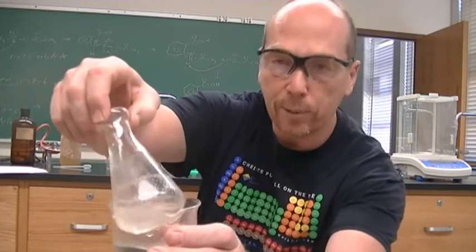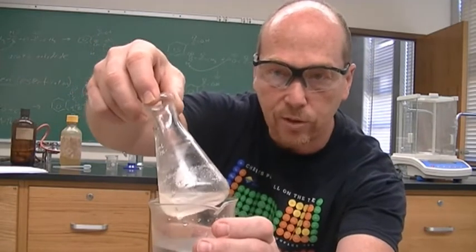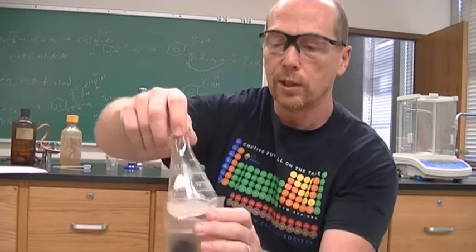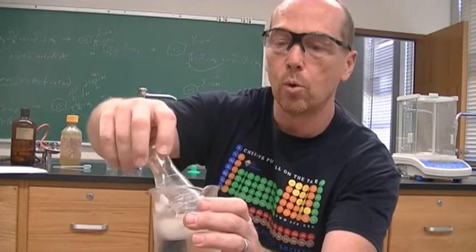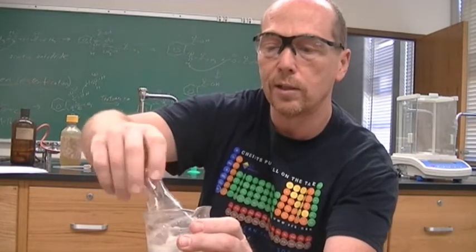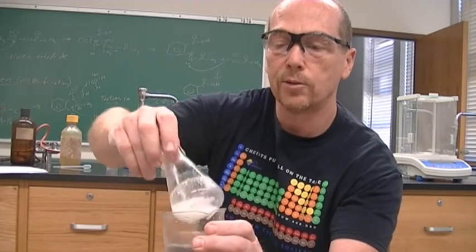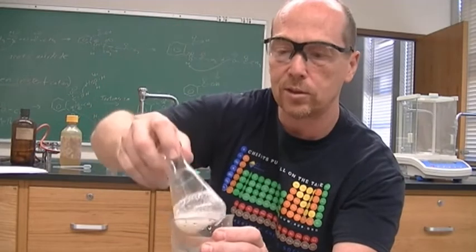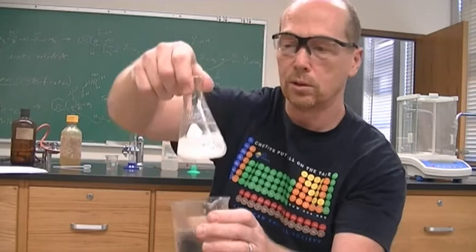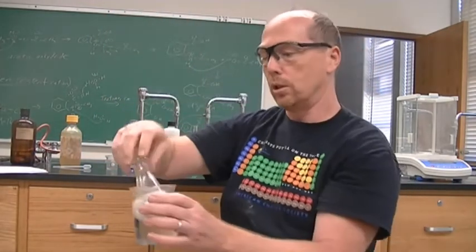So now I'm getting some crystals formed, so I don't have to add a seed crystal. I have crystallization on the side. You should be able to see that solid. As you keep swirling, you're going to get more and more solid. So we have lots of solid in the Erlenmeyer flask here. And so we have made our aspirin. Now the whole thing is a white solid mesh of aspirin.